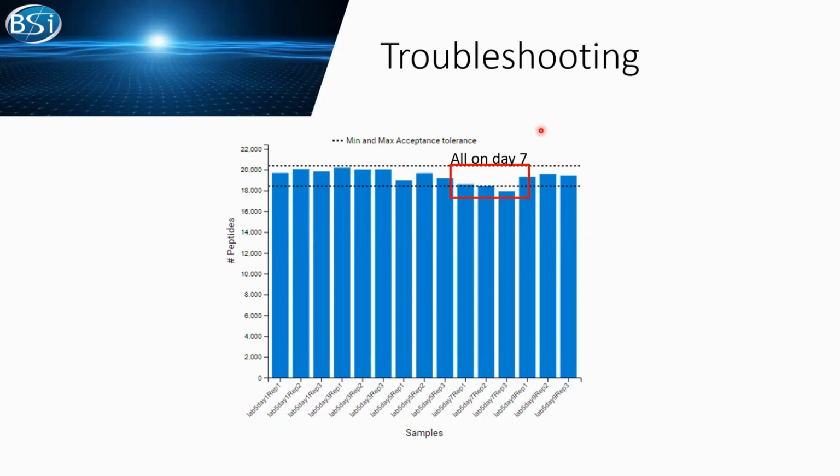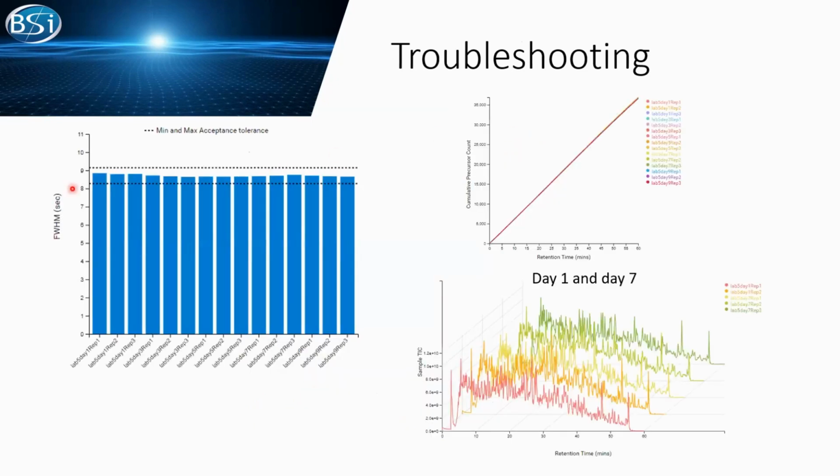From our previous case, let's take a wild guess. Could it also be LC issues? Now we are plotting our half-width metrics in the bar chart. In all my QC samples, the half-width of my peaks is looking great and seems to be behaving well. Here, we have the cumulative precursor count versus retention time. All my QC samples are overlapping almost perfectly, and that means my precursors are separated accordingly. It's all well behaved.